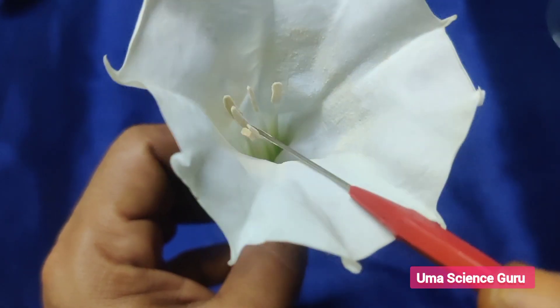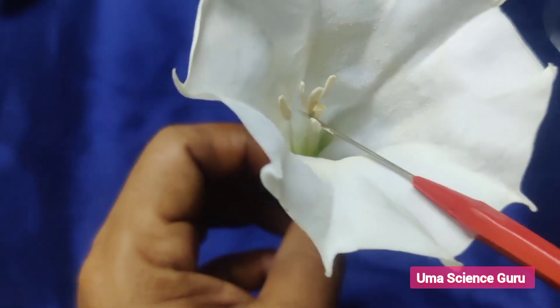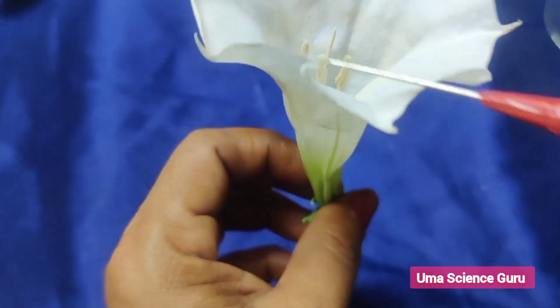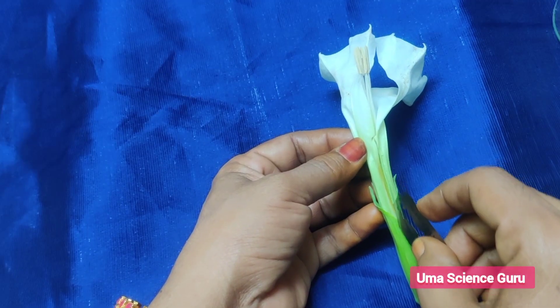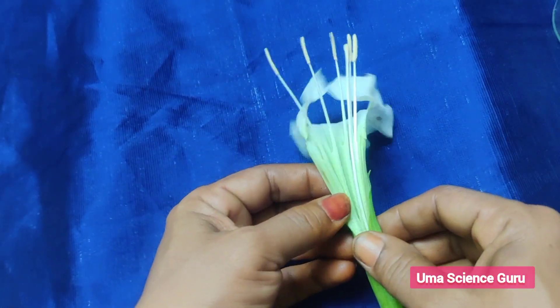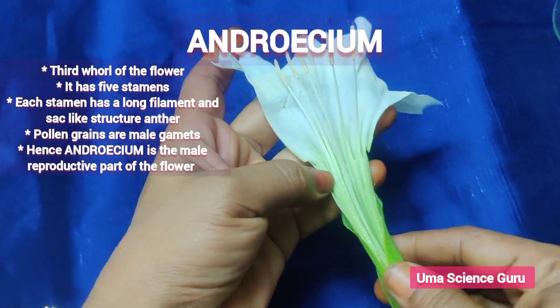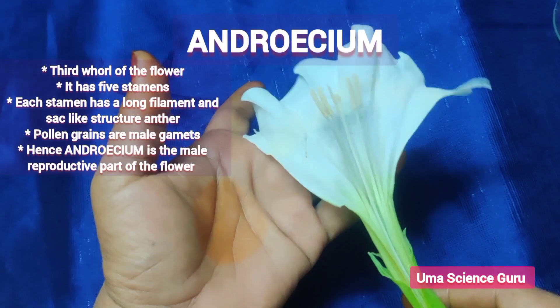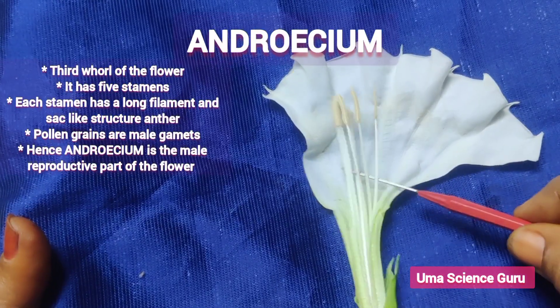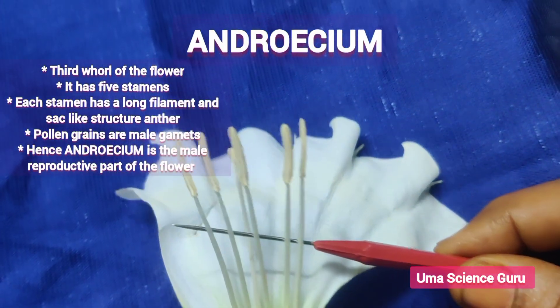Students, observe the soft elongated structures attached to the petals — they are called stamens. All the stamens are collectively called the androecium. This is the male reproductive part of the flower. Carefully cut the flower and observe the inner parts. Androecium is the third whorl of the flower and has five stamens.